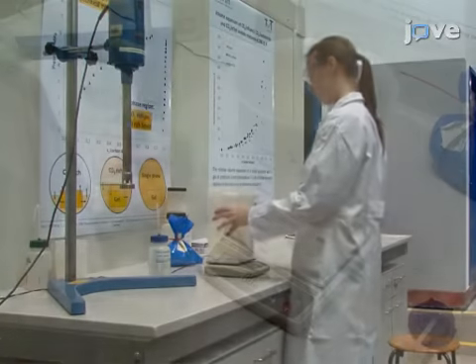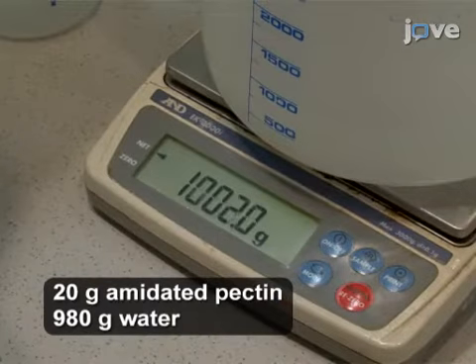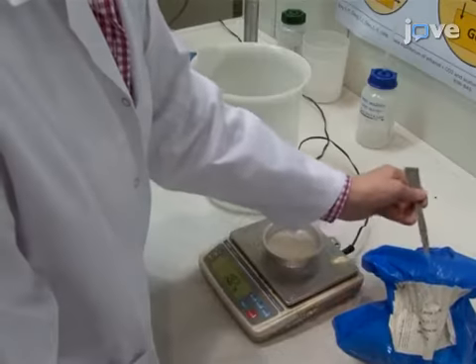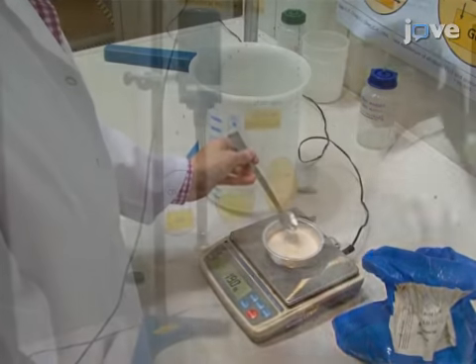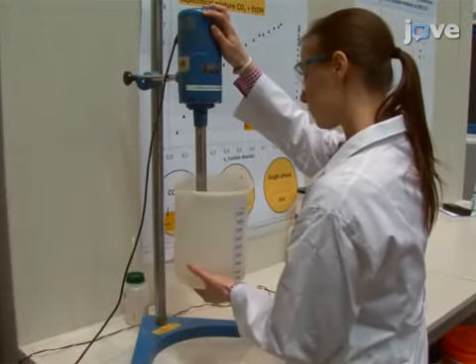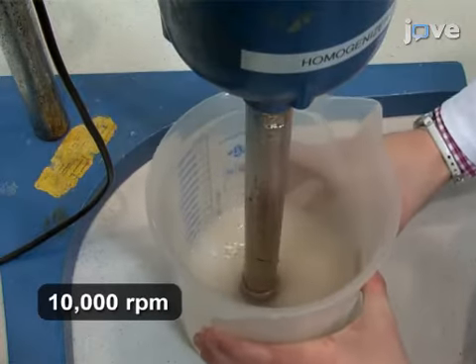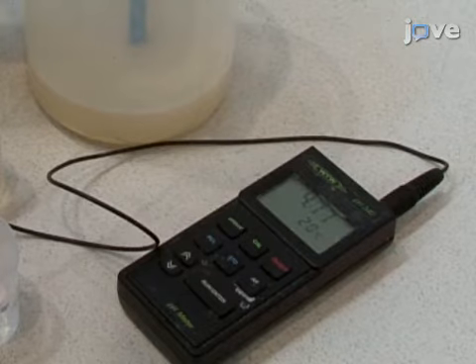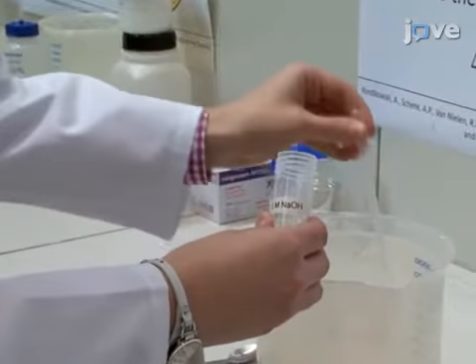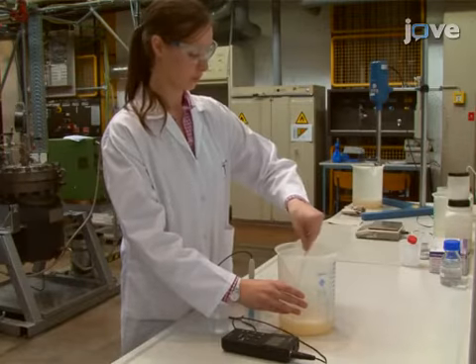This section demonstrates how amidated pectin and calcium carbonate dispersion is made in water. However, the procedure can be adapted to making many other solution mixtures. Homogenize a 2% pectin in water solution at high speed for 2 minutes to make a viscous solution. Then, check the pH. If it is lower than 6.5, titrate with 0.5 molar sodium hydroxide to neutralize the solution.